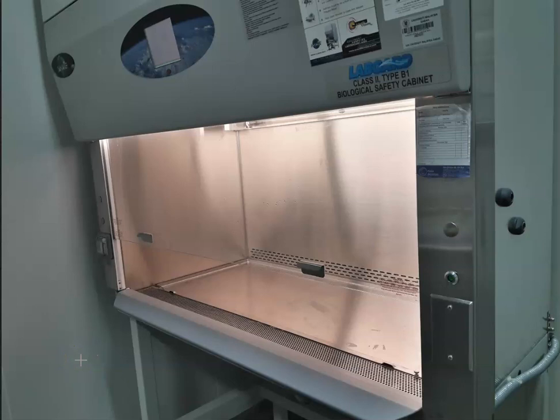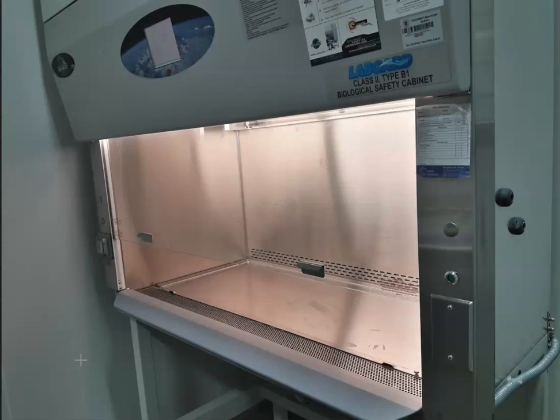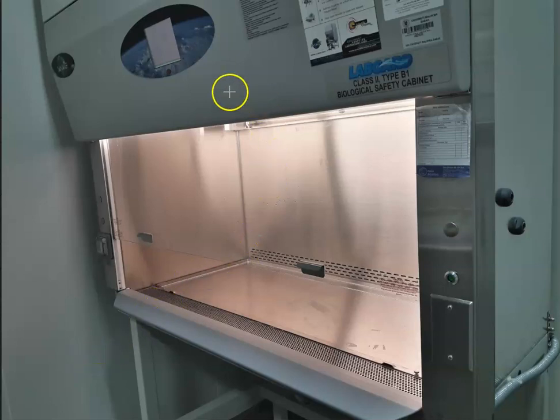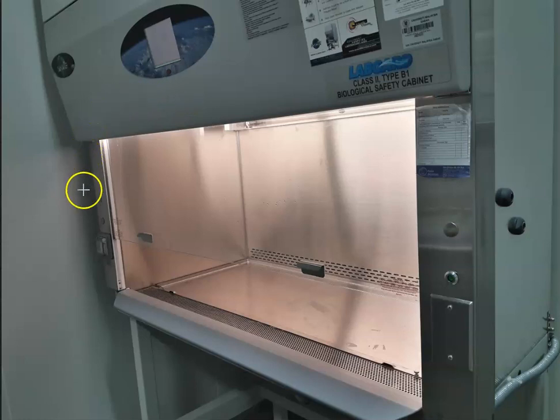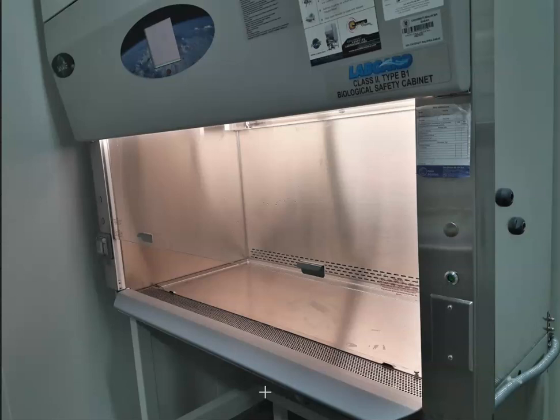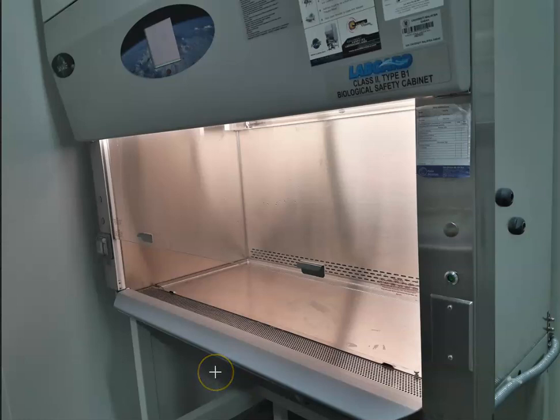Greetings and welcome to this massive open online course, Introduction to Biorisk Management. Today I will be discussing with you the usage of a biological safety cabinet. What you see in front of you on the screen is a biological safety cabinet, which is an example of an engineering control that can be utilized to effectively mitigate the risk posed by a biological agent.